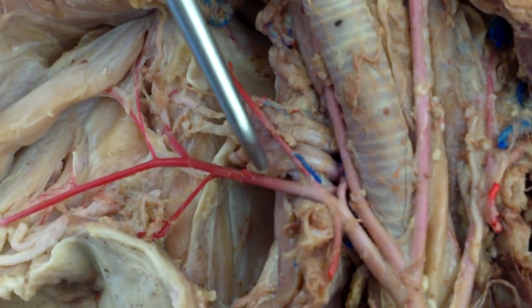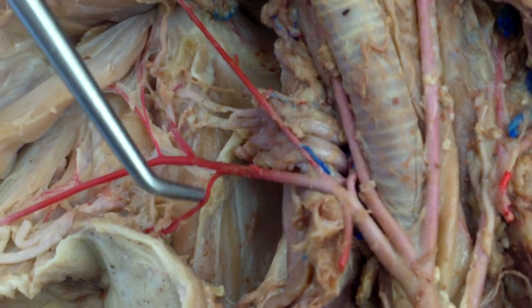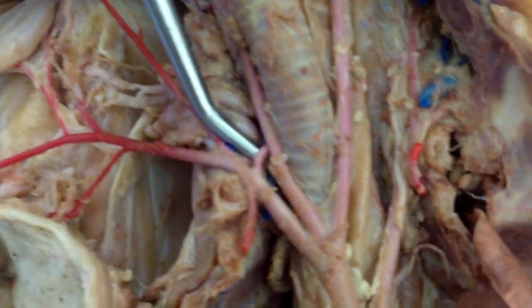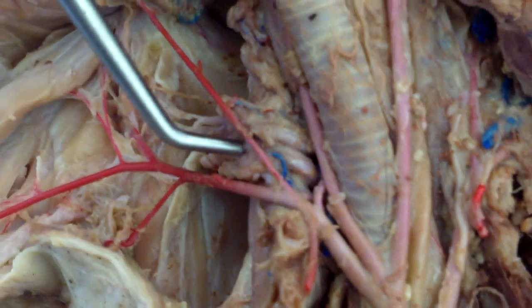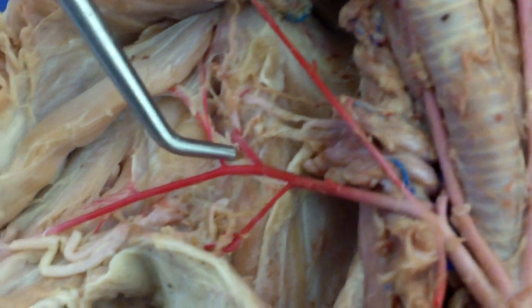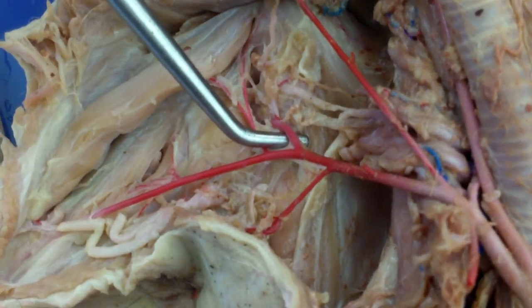VCT: the V is the vertebral, the C is the costocervical, and the T — right here — is the thyrocervical.